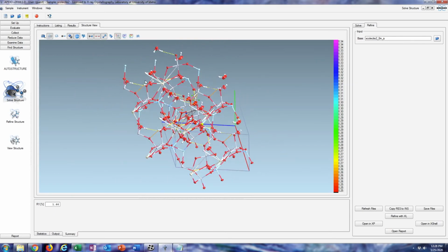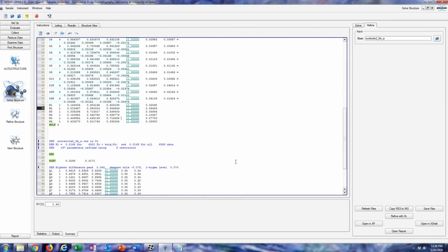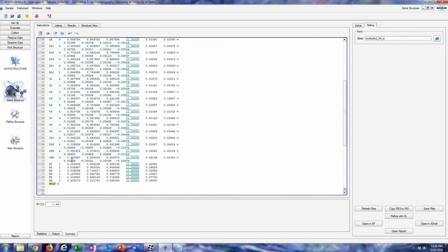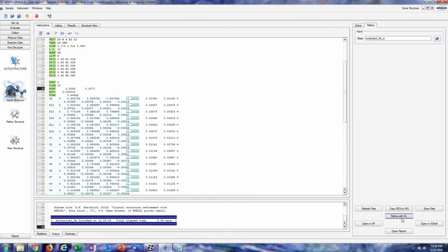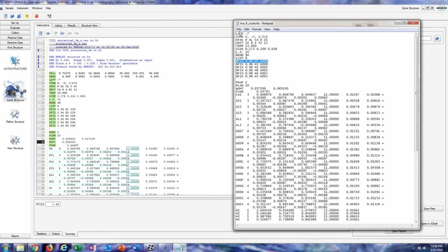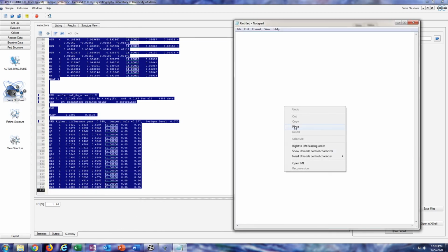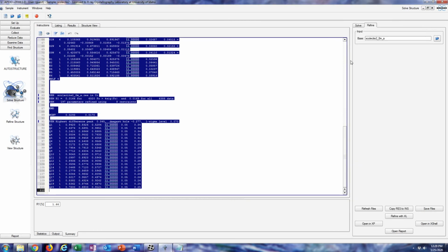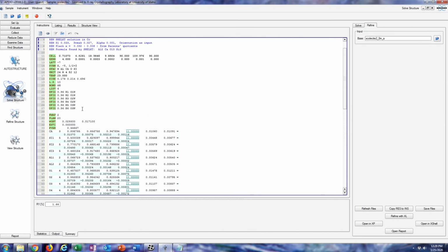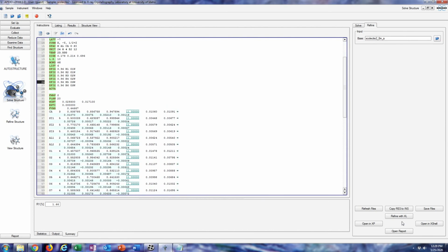To finalize the structure, you'll want to enter in an ACTA command to write the structure as a CIF file in that directory. The very last thing that you could do also is omit reflections, and I'll go through that in a bit here too. And it's always a good idea to copy from LATT on down to a text file so that you can always use that as a template or as a save. And ACTA, so this will write the CIF file.